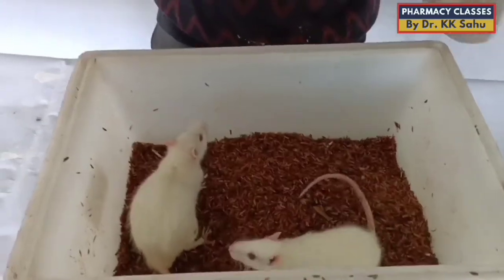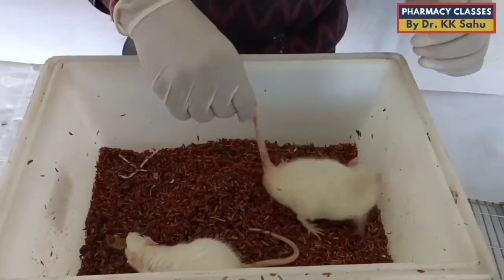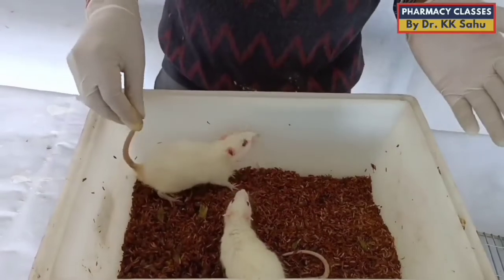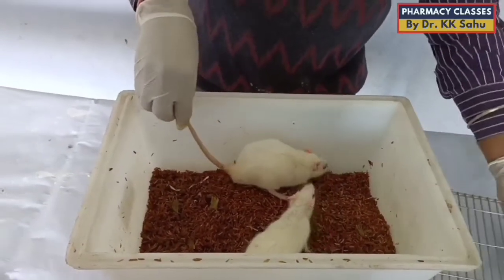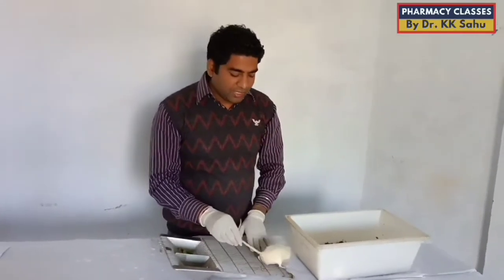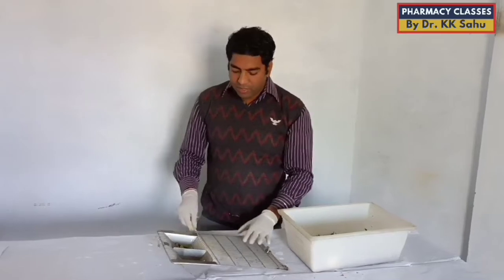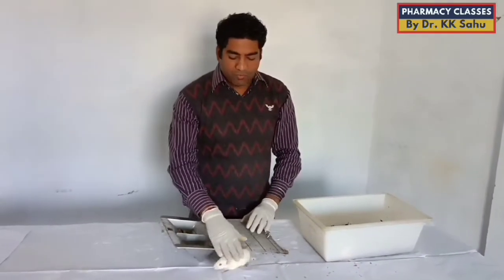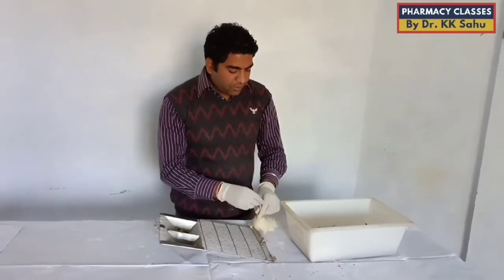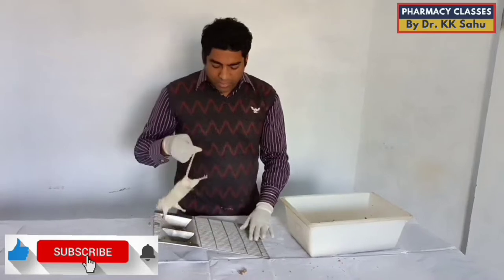Now I will show you the main difference, which is the genital organ difference between male and female rats, so that you can assure yourself whether it is a male or female rat. Here you can see I am holding it through its tail — it is the ideal method to remove it from the cage so that it will not bite and can be handled properly. Just after removing it from the cage, you should not hold it instantly; let it be stress-free and get familiar with your hand. Give some gentle massage over its back to make it stress-free.